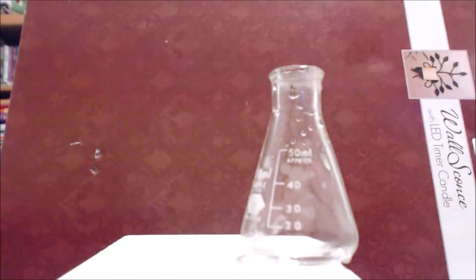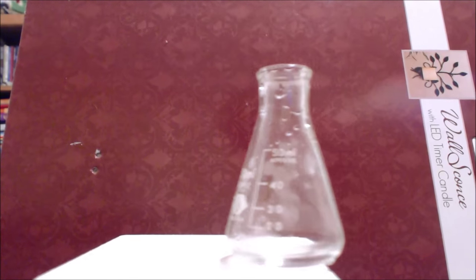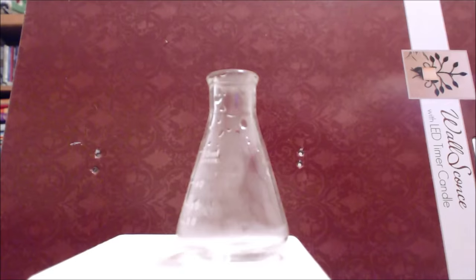Okay, well, pretty spectacular. Everything's kind of warm here. I'm going to turn the heat off. The water rapidly boiled off because the pressure dropped to one atmosphere inside.